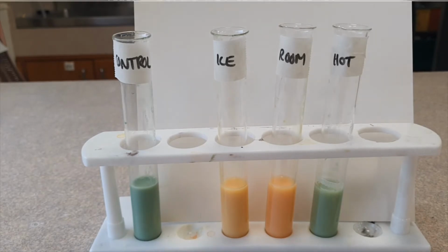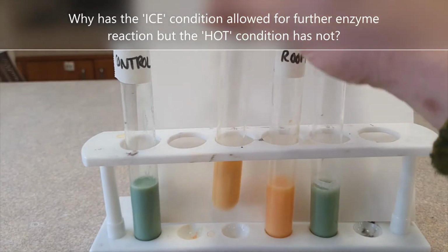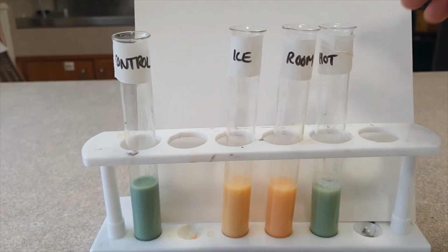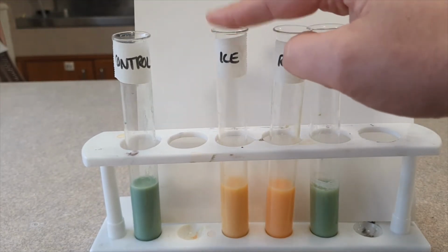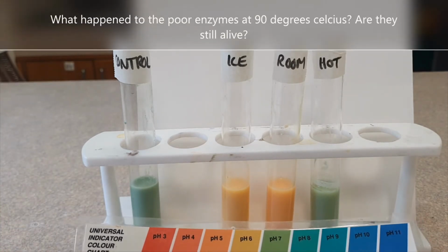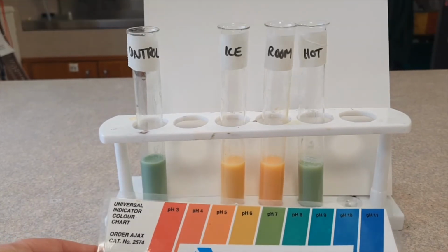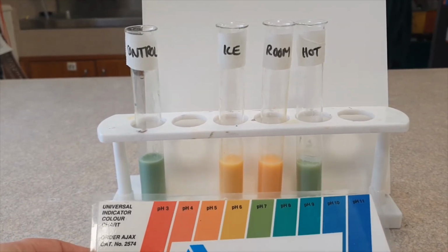Okay, so it's been about 10 minutes and it looks like we've had some more reactions happen. So ice looks like it's changed, but hot has not changed at all. I wonder why that is. What do you reckon? So I hope you enjoyed that fabulous prac and you get all the results that you need and you learn something about enzymes and lipase in particular.